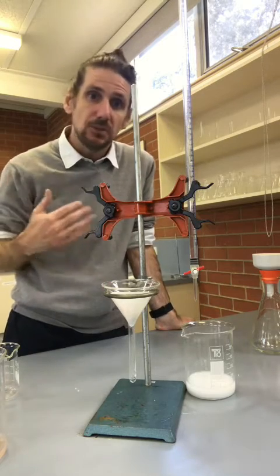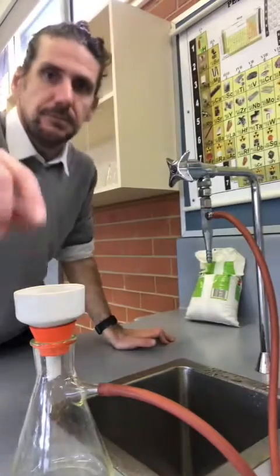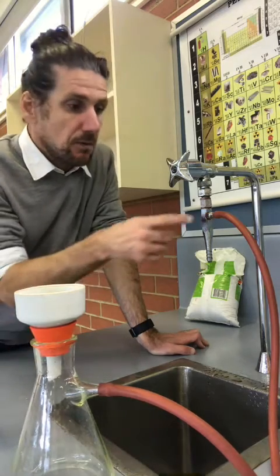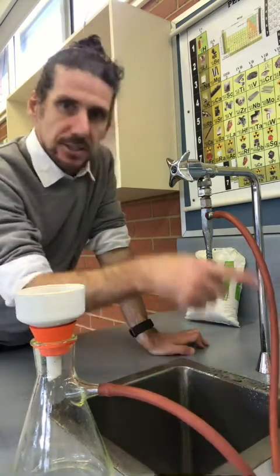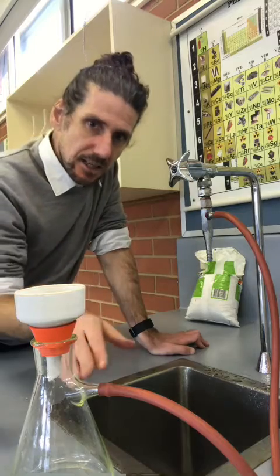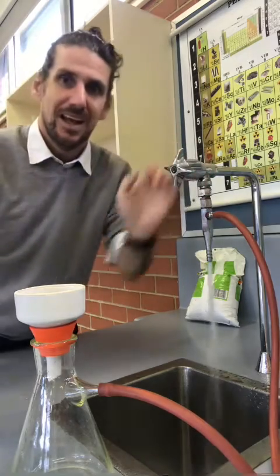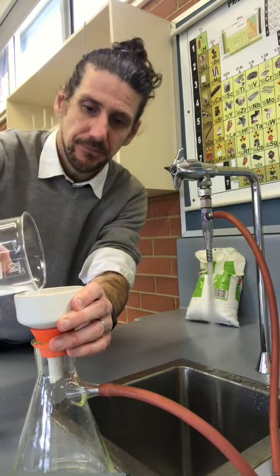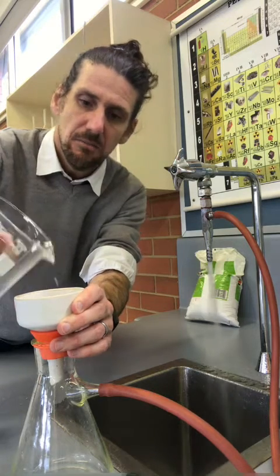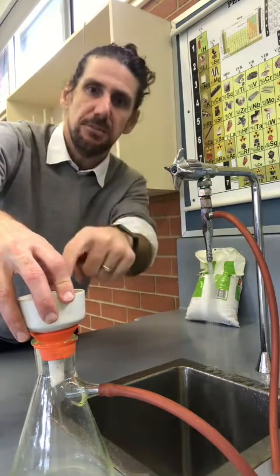Once we've got our precipitate we can filter it and determine how much barium sulfate there actually is. To filter the precipitate we're using a vacuum filter and a Buchner funnel. The hose is attached to the tap, and as the water rushes down it creates a vacuum that sucks liquid through the flask. When I turn it on and tip this in, the vacuum pulls down the liquid and the filter traps the precipitate.